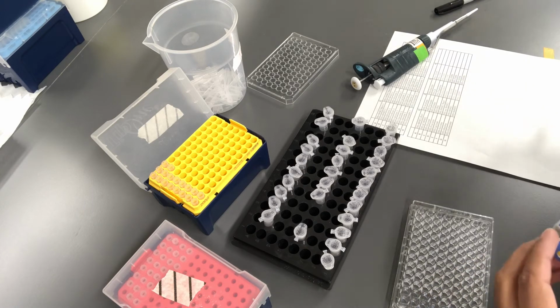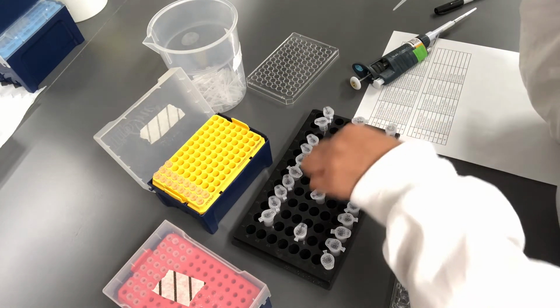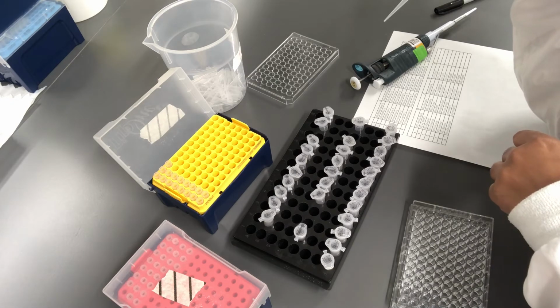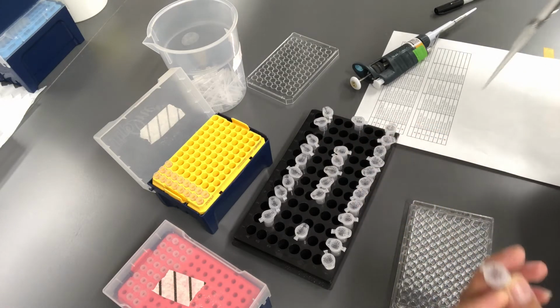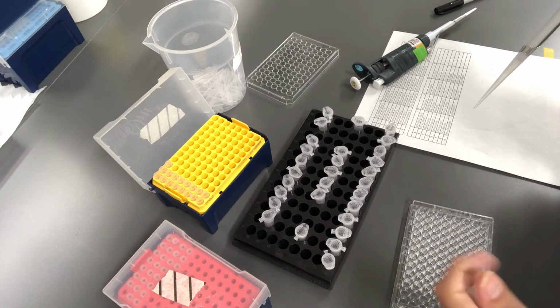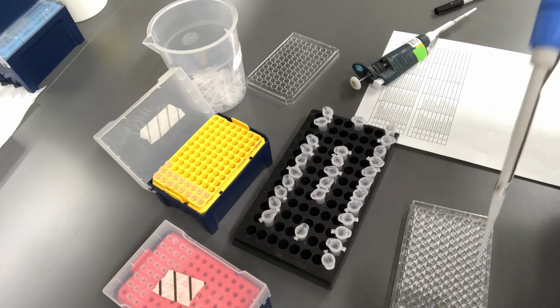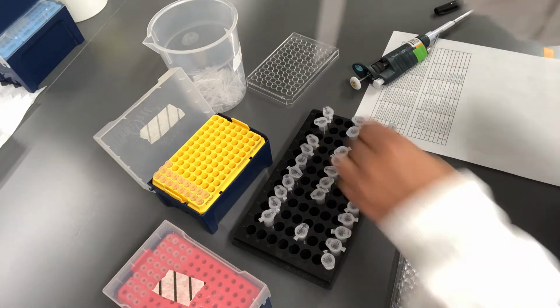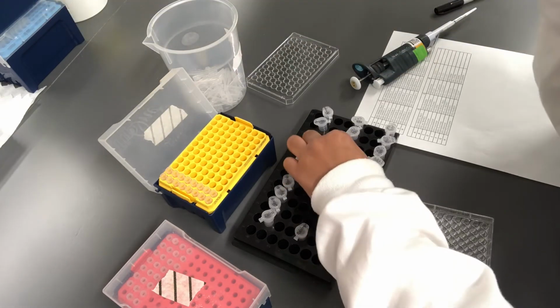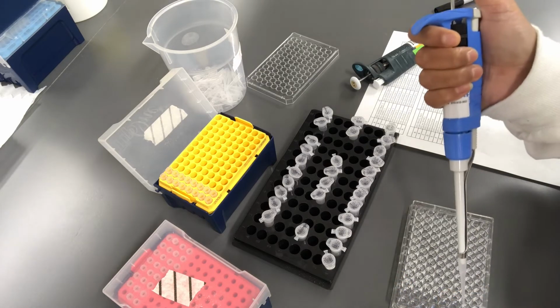Now I'm going to move on into nitrogen experiment, and the first two wells are going to be controls again. The first one is going to be a control without bacterium, and the second one is control with bacterium. For that, I'm going to grab mineral salts medium without nitrogen, and that is labeled as MSN. So two of the controls. Then the rest of the nitrogen containing media as per mentioned in your lab manual.